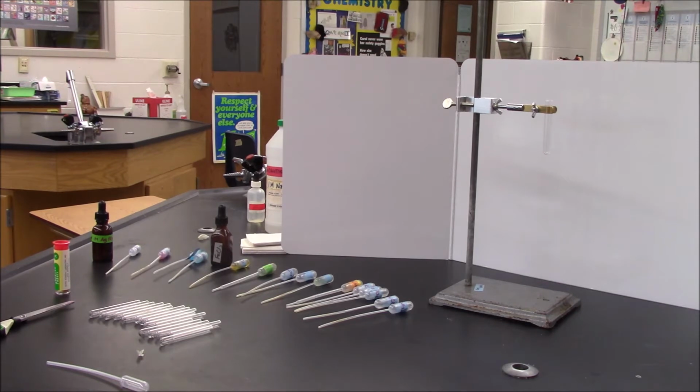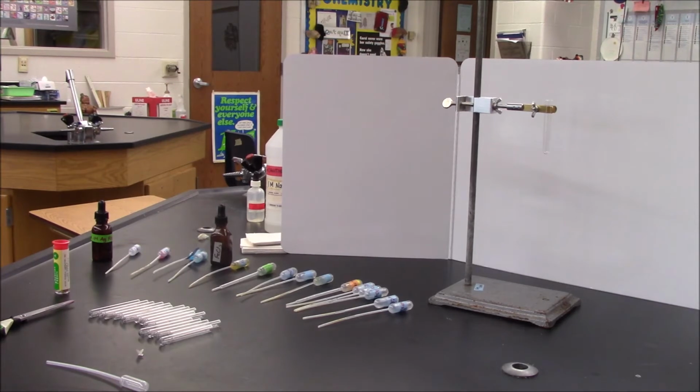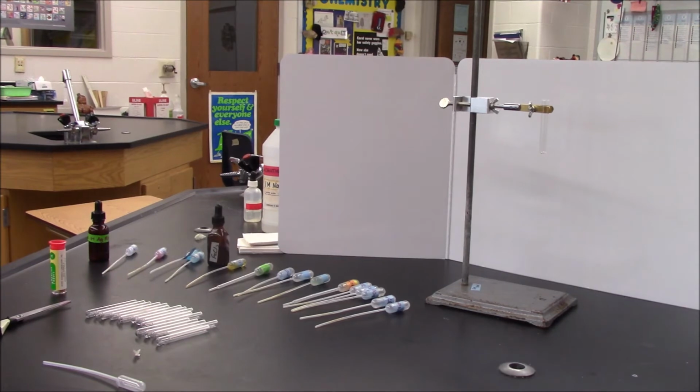In addition to this lab being fun, it is meant to help us practice our understanding of why double replacement reactions take place, and practice in terms of writing formulas for ionic compounds, which are the products for all of these processes.